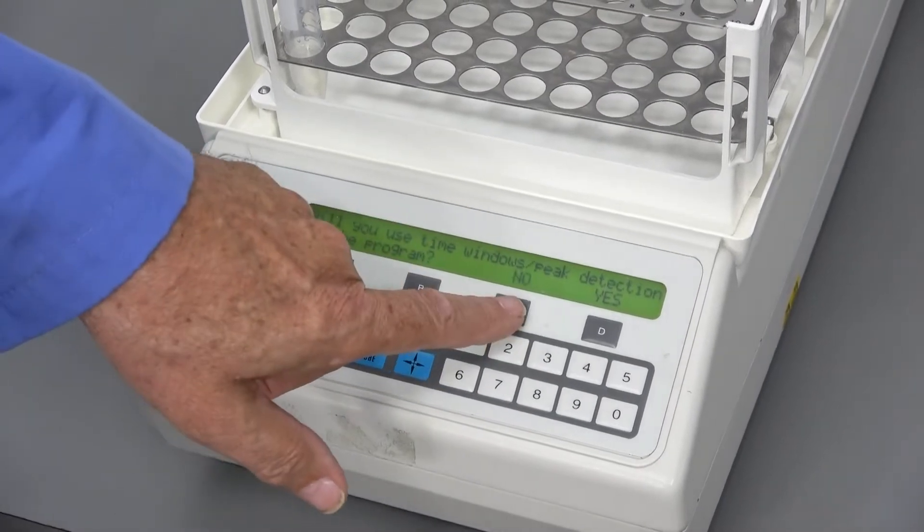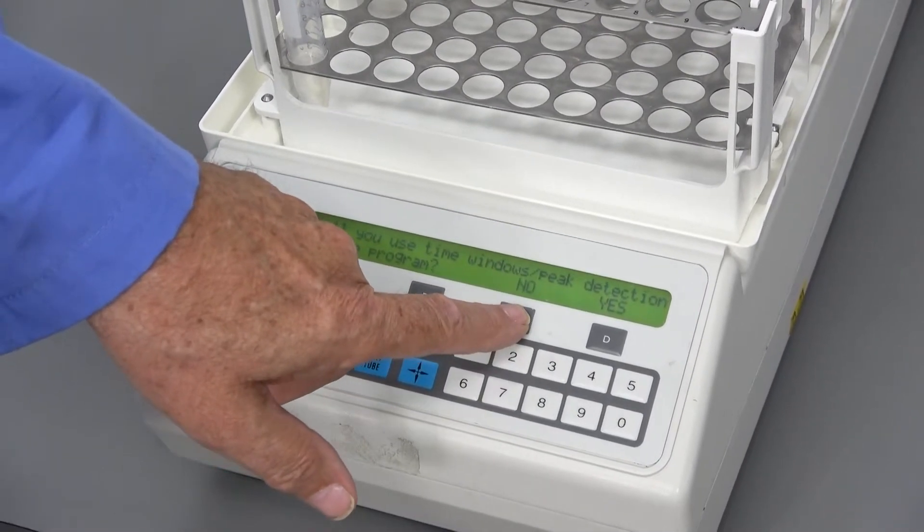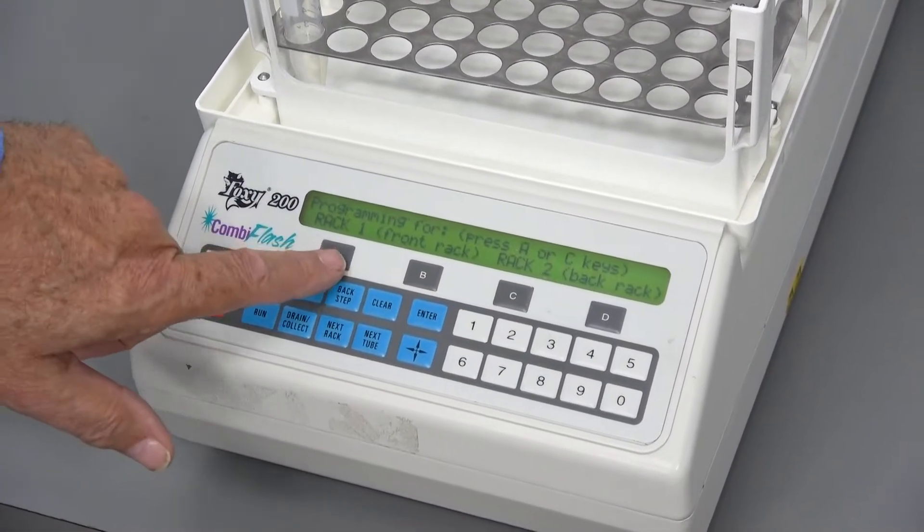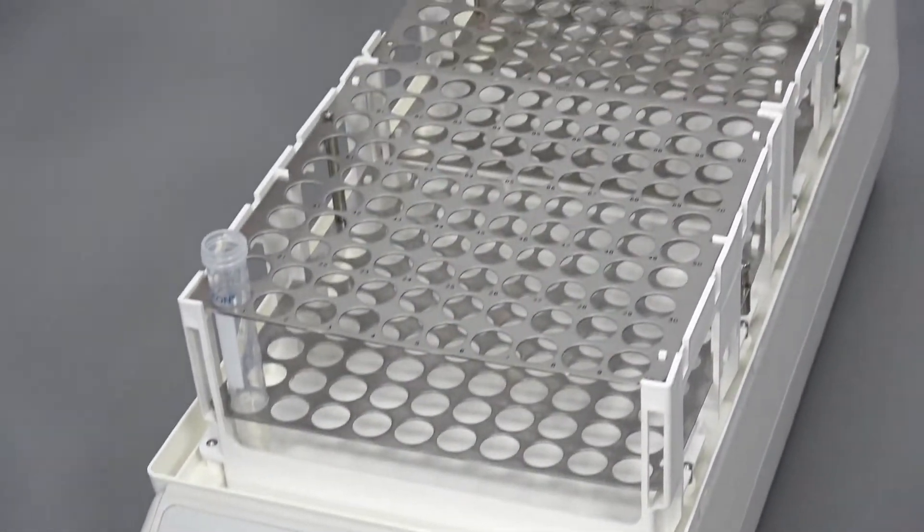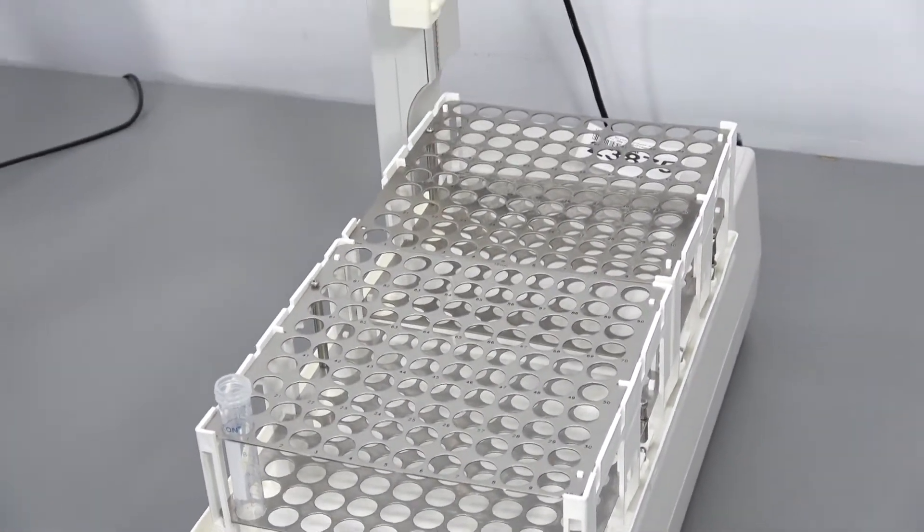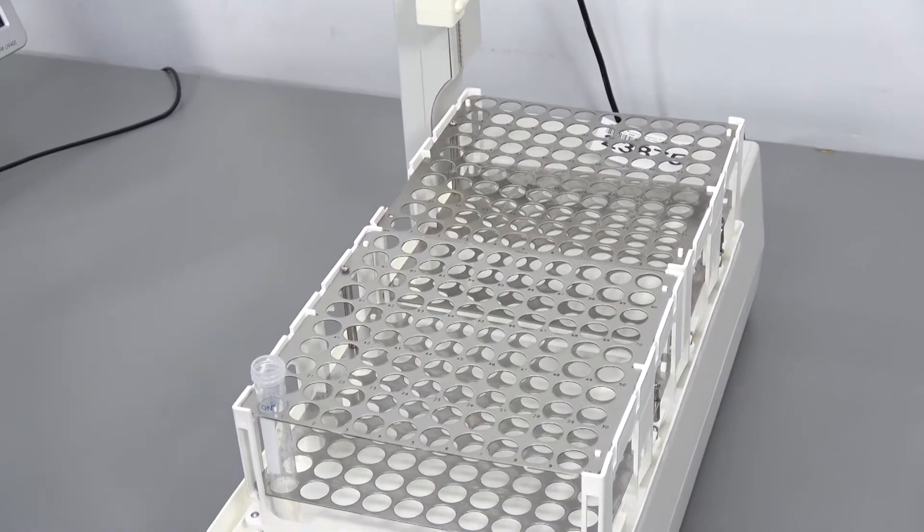It's asking if we want to use the peak detection system. No, in this case we do not. We can program the front and rear rack separately. We're programming the first one.